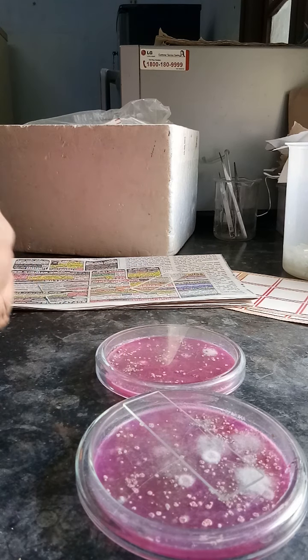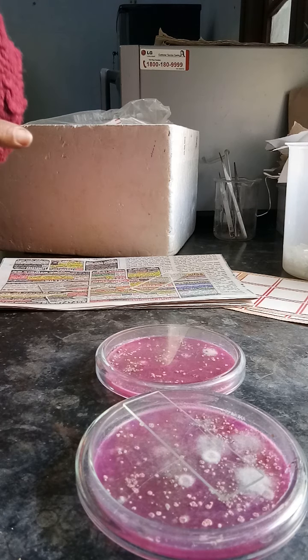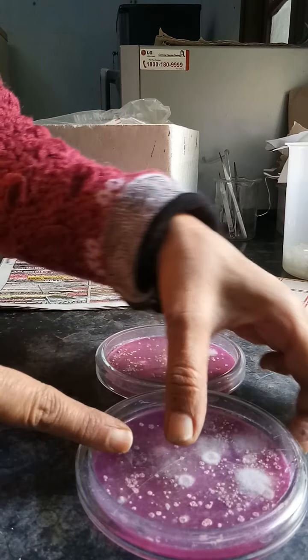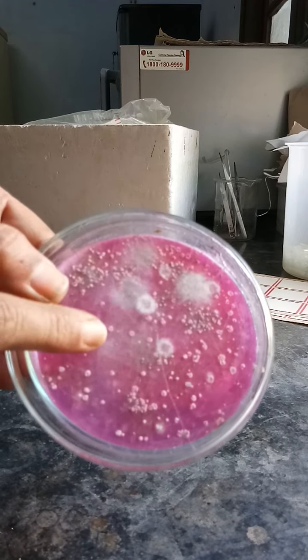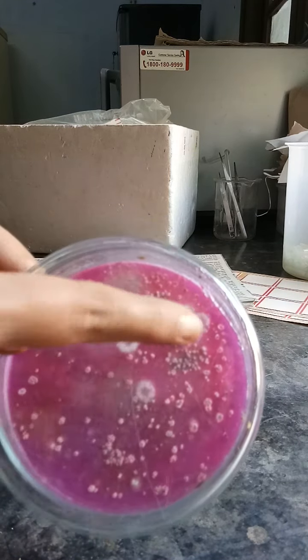Hello second year students. Now we are going to see how we are going to identify fungi after we get the growth. First of all, I will show you the plate of rose bengal agar media in which you can see the fungal growth. You can see very nicely that filamentous growth is found in some areas of rose bengal agar. Now I will show you stepwise the method to mount this particular growth.